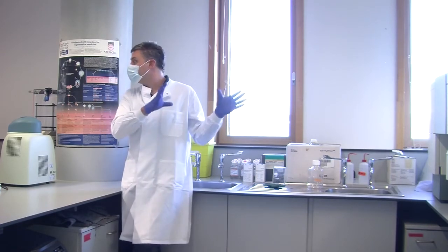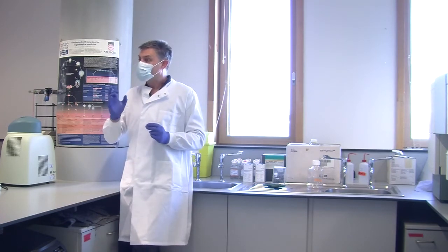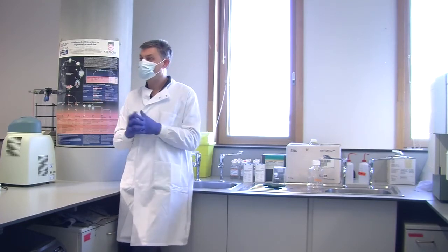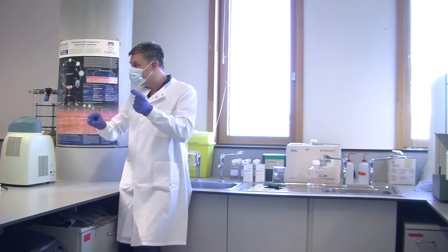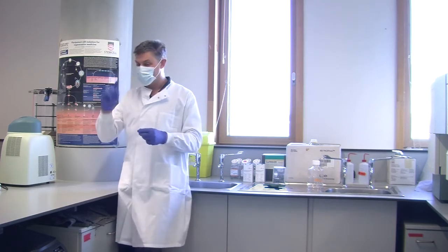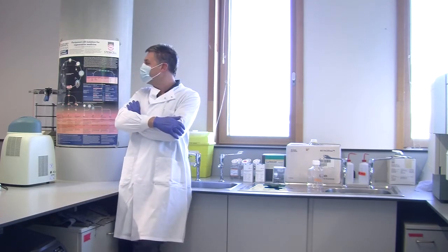With cytometers, when I'm teaching people hands-on, there's one type of cytometer where it draws up loads of air if you don't put your tube in at a particular point. And I always say to people when I'm running the course, when it says this prompt, put your tube in, then click OK, don't click OK, then put your tube in. And then we'll go through it and say, right, you load some sample, and then click on the thing, and the prompt will come up, and then click OK, and I'd stand there going, yeah, right, OK.